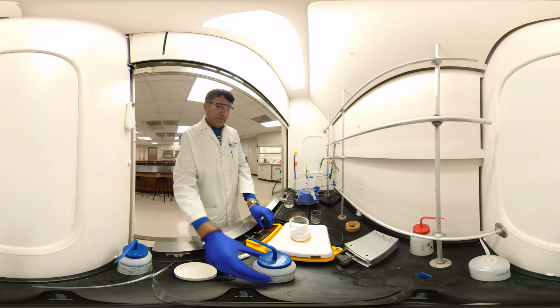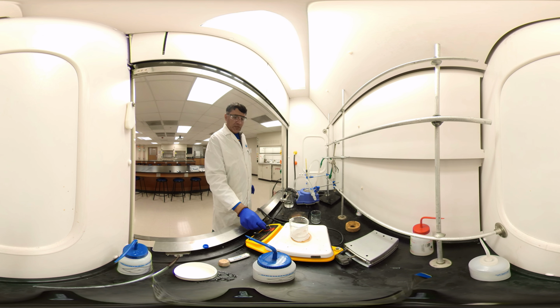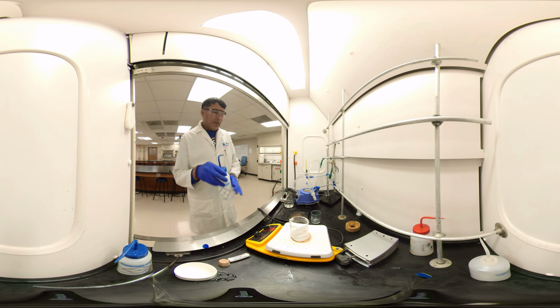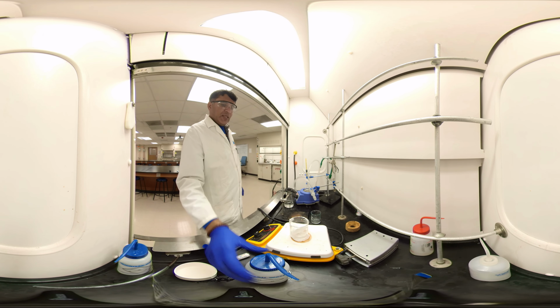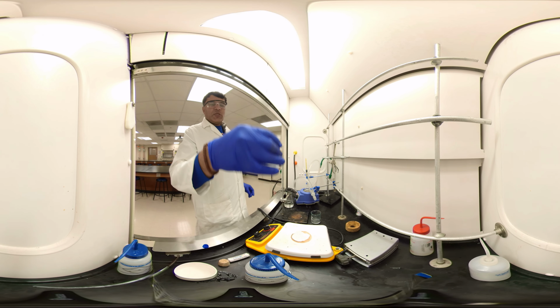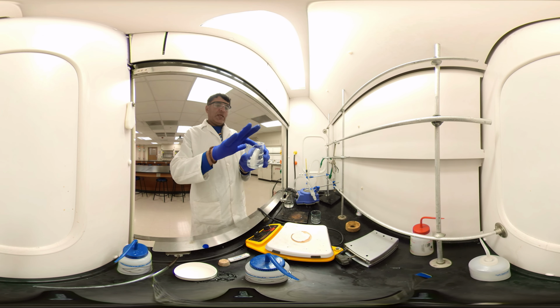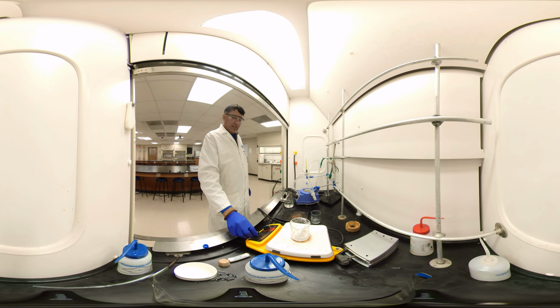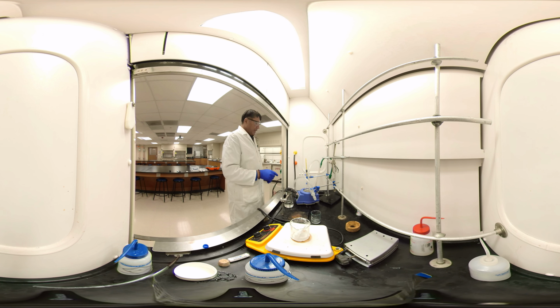And I start heating. Okay, my hot plate is on. So I'll heat it slowly until it dissolves. I'm doing the experiment in parallel here. In one place I'm trying to recrystallize benzoic acid. It is insoluble in cold water but will be soluble in hot water. So we have transferred it here. Let's heat the water with the magnetic stirrer. Okay, slowly. And on the other side, we are removing the dichloromethane. But now let's move this one to the side.